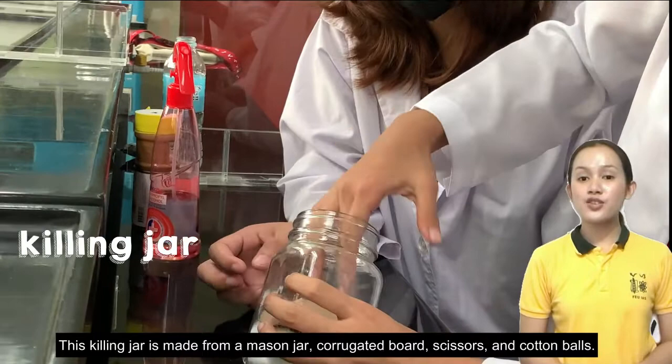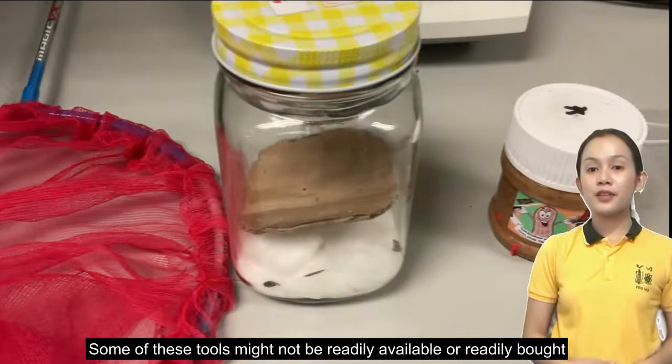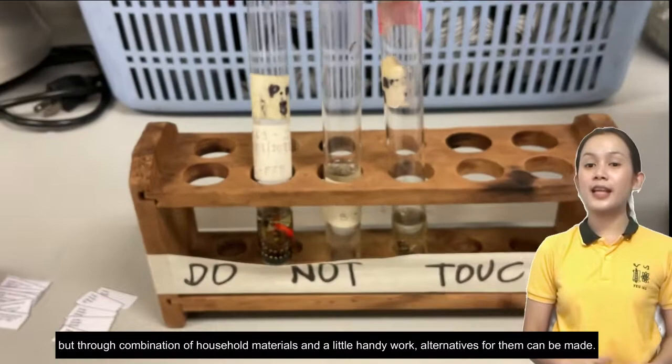Lastly, we have the killing jar, used to slowly kill insects without damaging their morphology. This killing jar is made from a mason jar, corrugated board, and cotton balls. It is loaded with chloroform as the killing agent. Some of these tools may not be readily available or bought, but through the combination of household materials and a little handiwork, alternatives can be made.